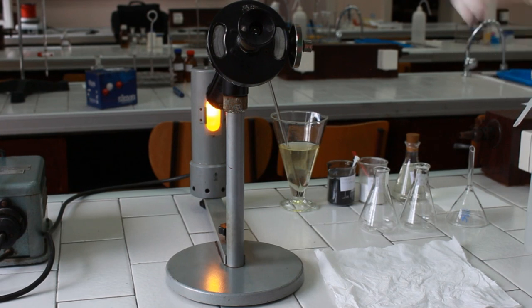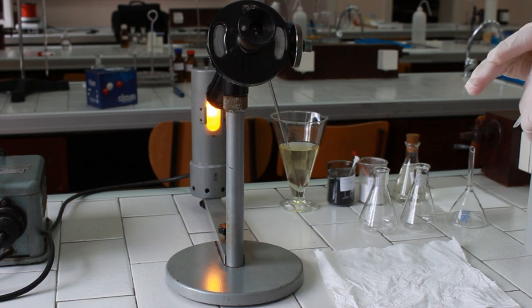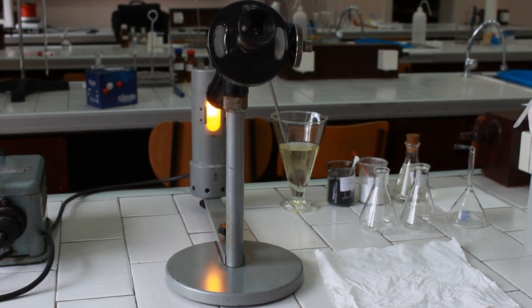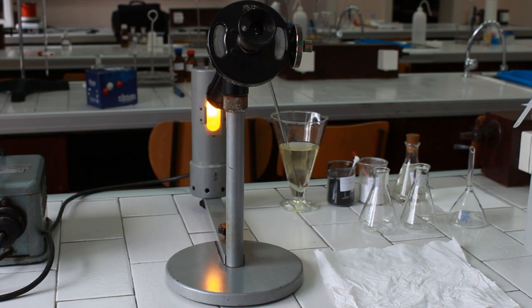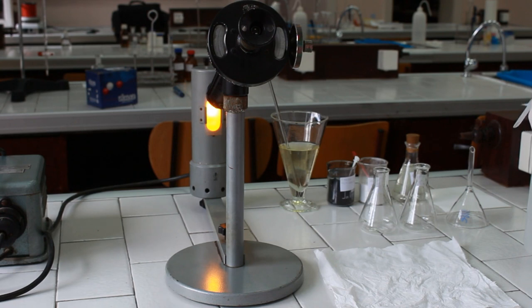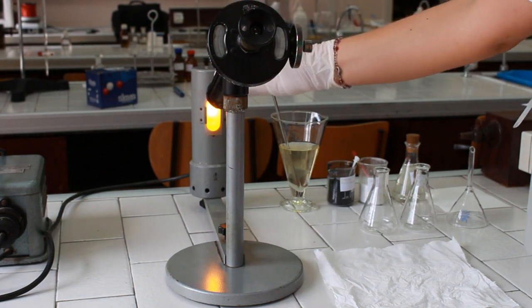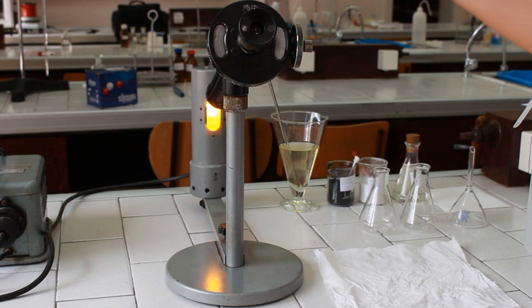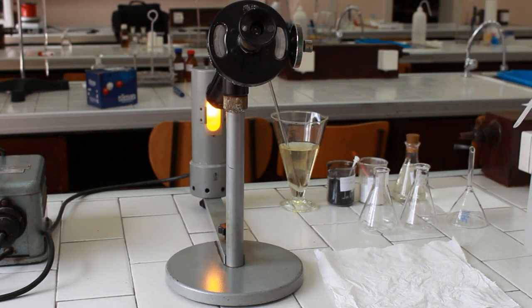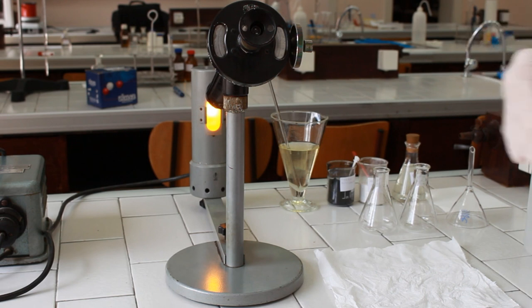A polarimeter is an instrument which possesses a lamp — which emits a wavelength of 589 nm, usually a sodium lamp used for polarimetry. This yellow light passes through a polarizer, a part of the polarimeter which transforms the ray of monochromatic light and turns it into polarized light.